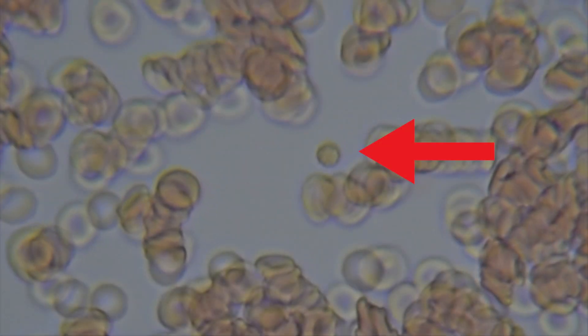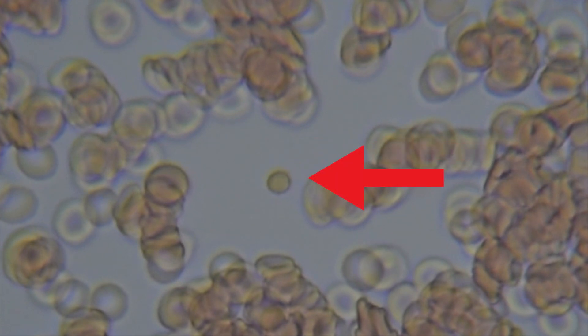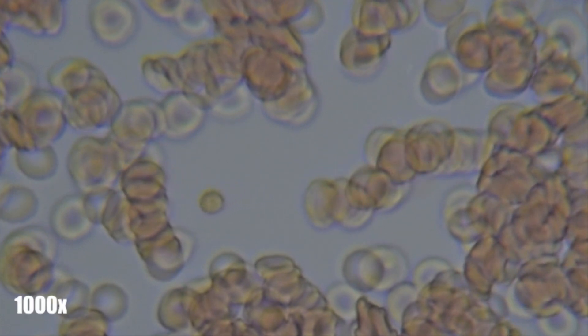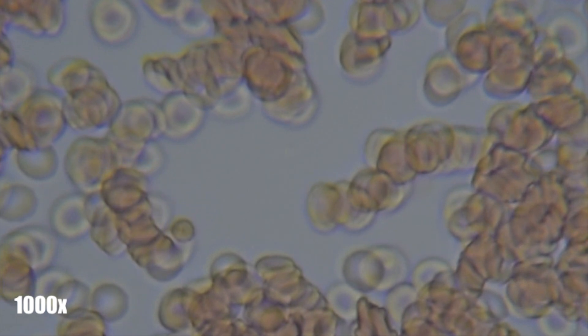Here you can see one of the different cells I mentioned earlier. A later video will be made of other types of blood cells, but until then, do you have any guesses on what this is?